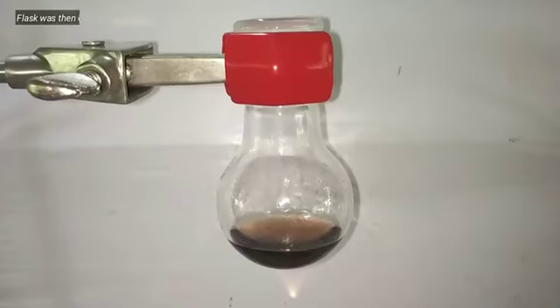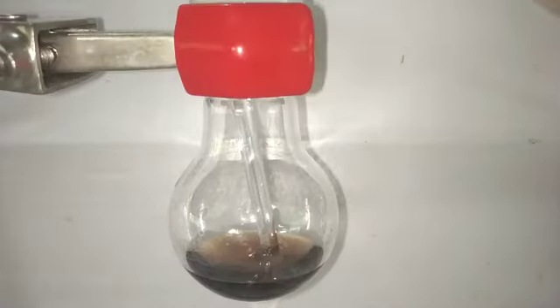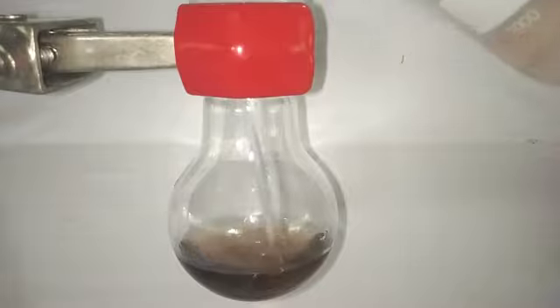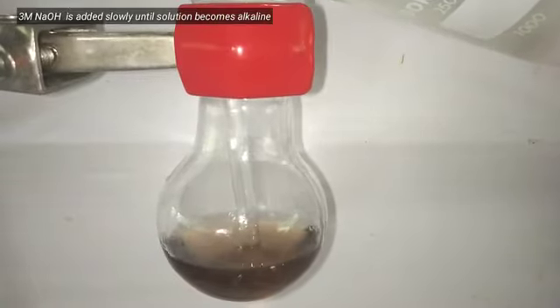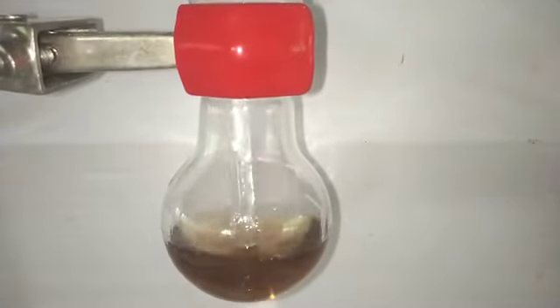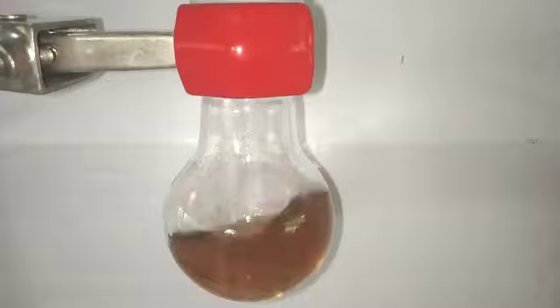After 2 hours of reflux, we will take out the condenser and then let the flask cool down to room temperature. Then we add the 3 molar sodium hydroxide solution along with constant stirring. The neutralization point can be checked by using a red litmus paper which will turn blue, indicating the solution turned just basic. By this time the precipitate will be already out in the solution.